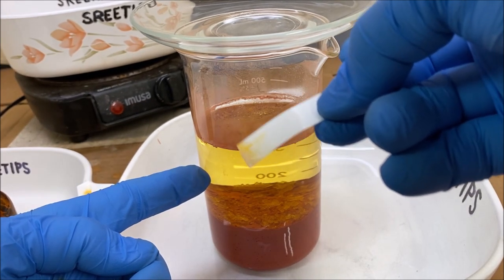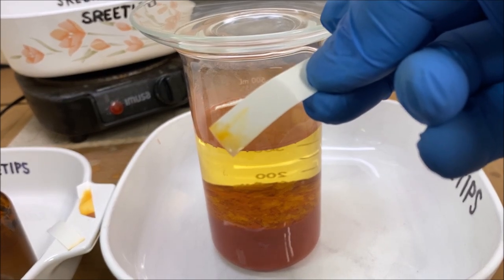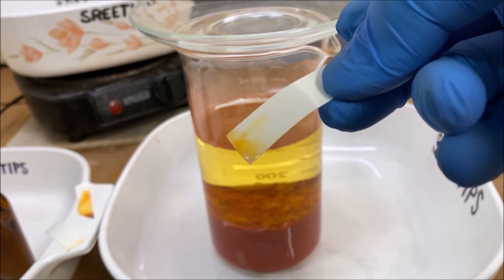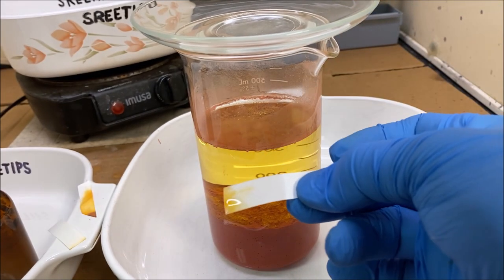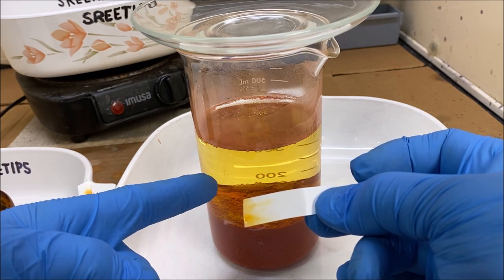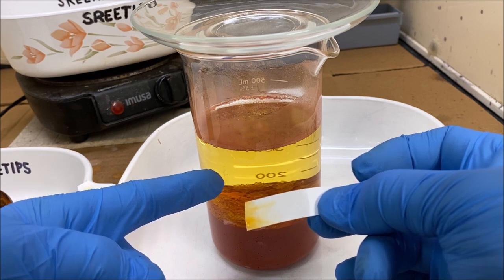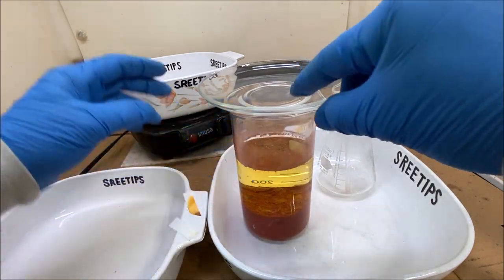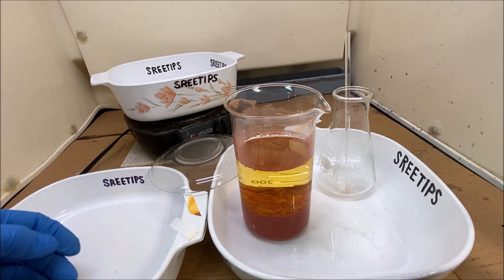There's a little bit of platinum left in solution. Now the temptation here is to put some more ammonium chloride in there and get the rest of it out. If it was gold we could do that - just add more precipitant and get 100% of the gold - but with platinum it's totally different. We're just going to have to let that go. Please understand that I don't have a lot of experience with platinum and I'm kind of making this up as I go.